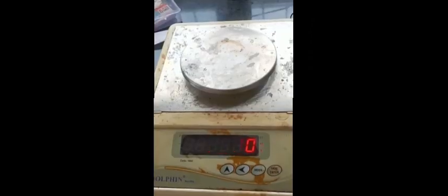In this experiment, our crude drug is clove powder. The aim of our experiment is to isolate or distill clove oil from clove powder. To perform this practical, firstly we should weigh clove powder about 20 to 24 grams. Weigh the powder properly.